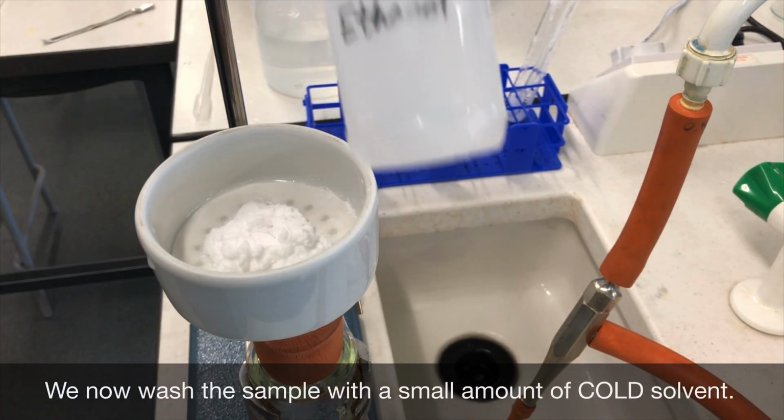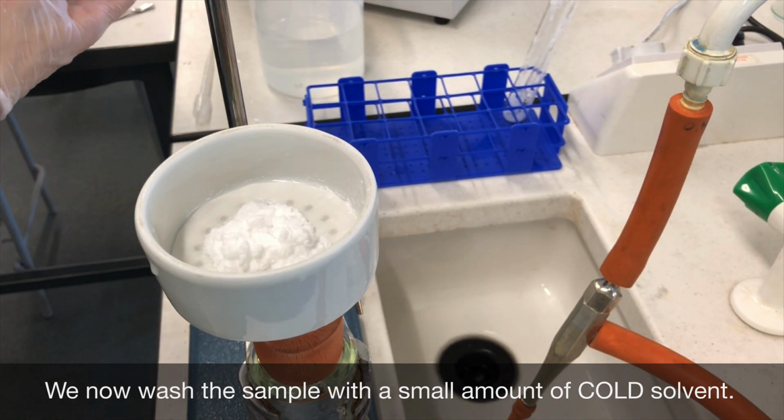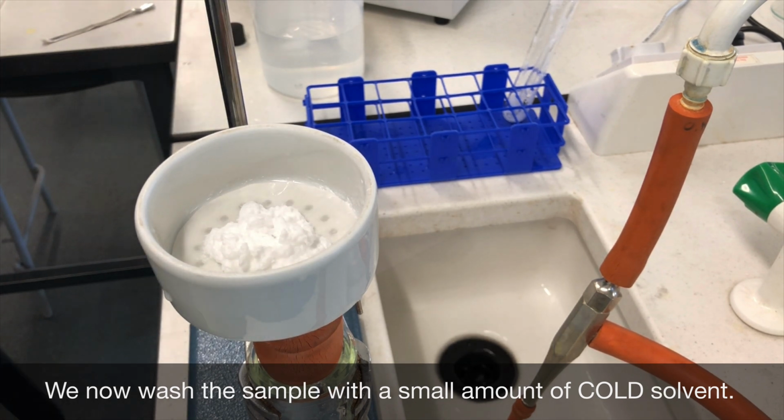At this stage now, we wash the sample with a very small amount of cold solvent. This allows us to remove any further soluble impurities that might be still present in the sample whilst it's in the Buchner funnel. You must make sure you use the same solvent that you used earlier in the experiment, but this time it absolutely must be cold.